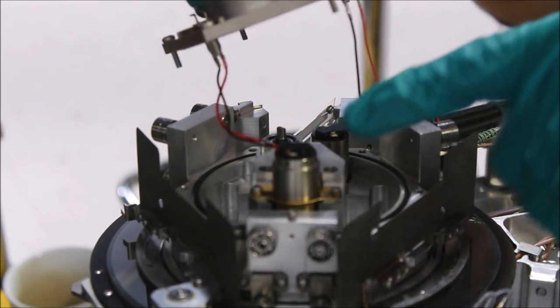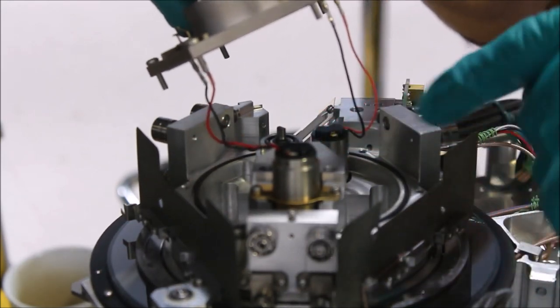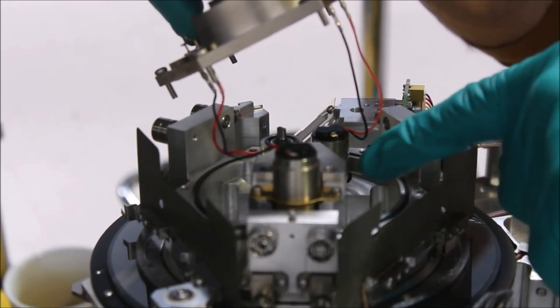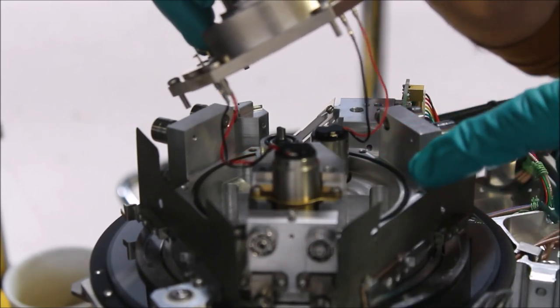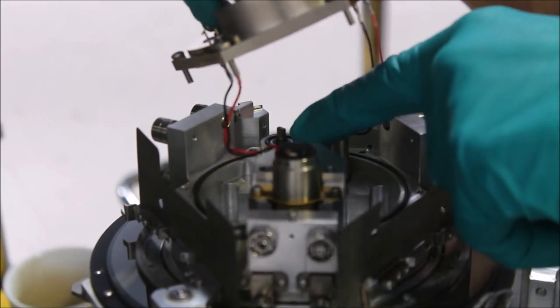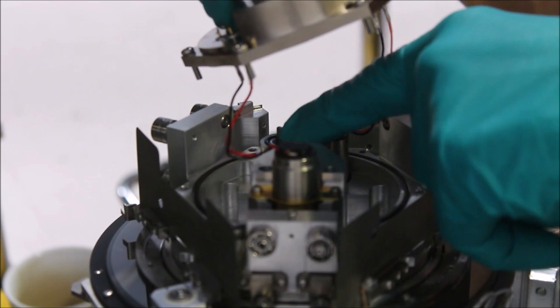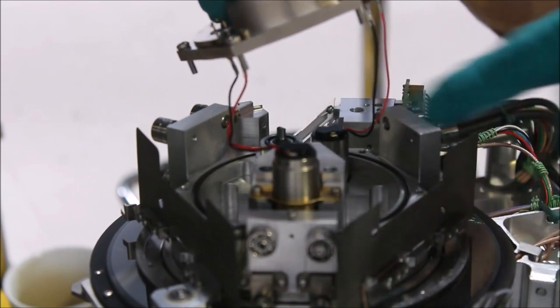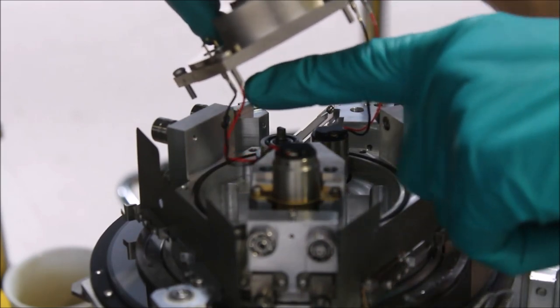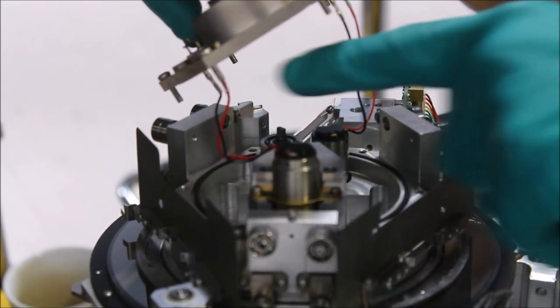Here's the little rotation motor, here's the Z motor. This little plastic gear is the rotation drive and this little stub over here is the little finger that pushes Z up and down. We can remove the plate after disconnecting these wires.